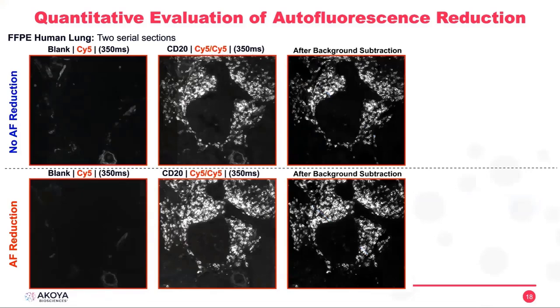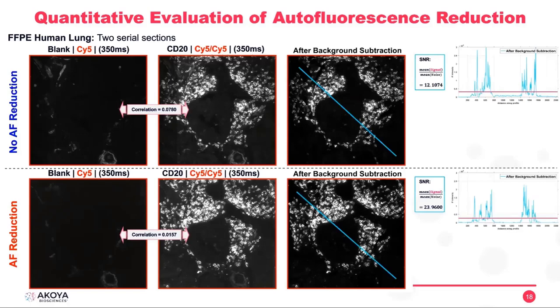And here we are looking again at the CD20, the same tissue, same region, but with the Cy5. As you can see, for the Cy5 we always have less background, and it goes even lower when we do AF reduction. And the correlation also goes lower from 7% to 1%. Signal to noise ratio is double when we do autofluorescence reduction. And we can always see that the noise becomes flat on this profile.